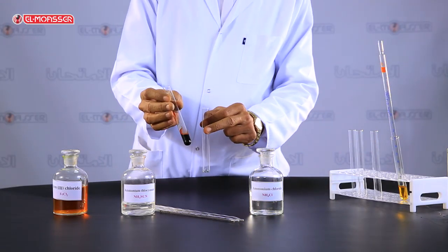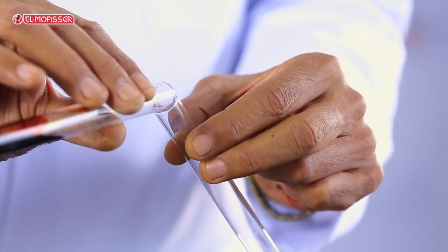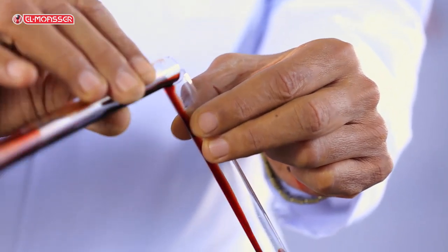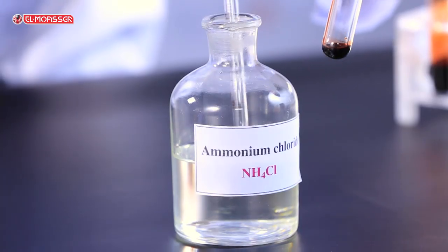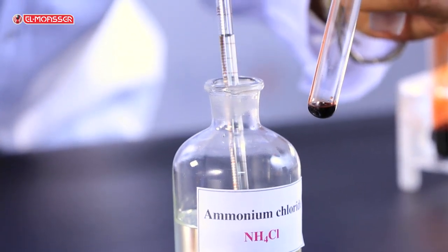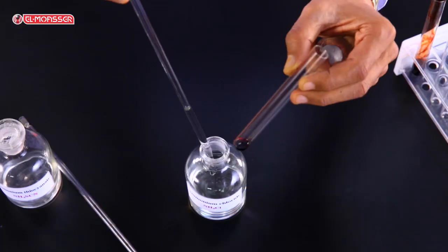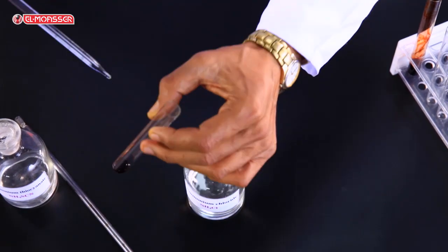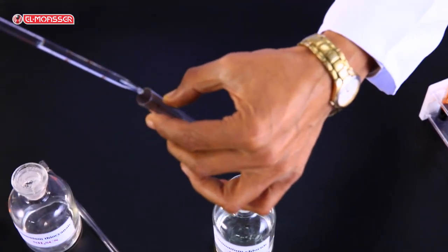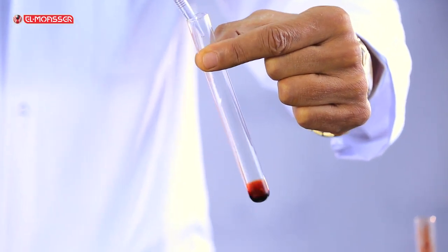Transfer a portion of the reaction mixture to another test tube. Use a pipette to transfer an amount of ammonium chloride solution, which is one of the products. Ammonium chloride solution is added to the reaction mixture drop by drop.